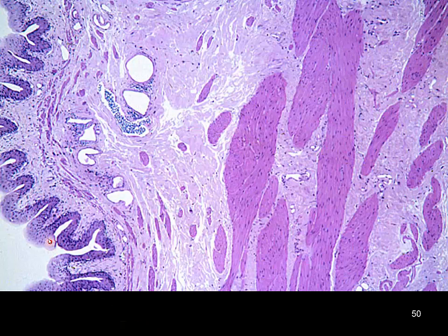So once again, we have our transitional epithelium. We have just small bundles of circumferential smooth muscle, and then these larger sections of smooth muscle. All these nuclei present here, this reddish color, which is going to be indicative of muscle, it's going to tip you off that we're in a hollow organ. We're looking in these deeper layers. That's going to be our smooth muscle.